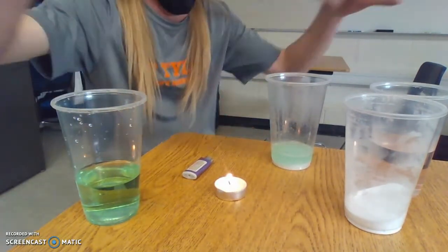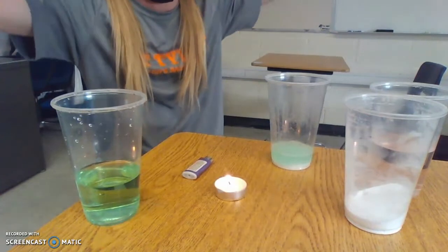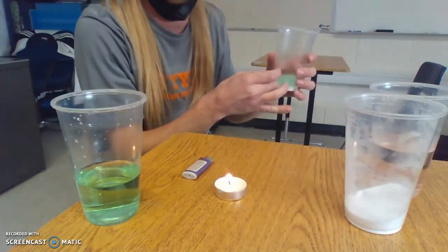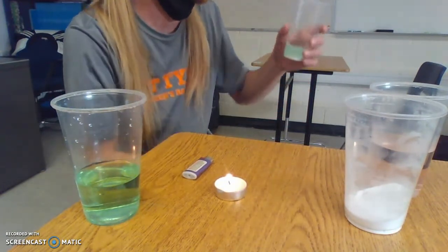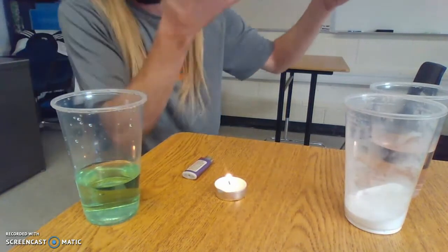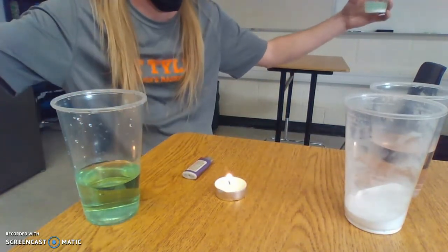So what happens is our atmosphere has a lot of nitrogen and oxygen and the stuff that's bouncing around, but when I produce this heavy gas at one time, right away before it dissipates and spreads out through the atmosphere, it's heavier than the gas in this room.